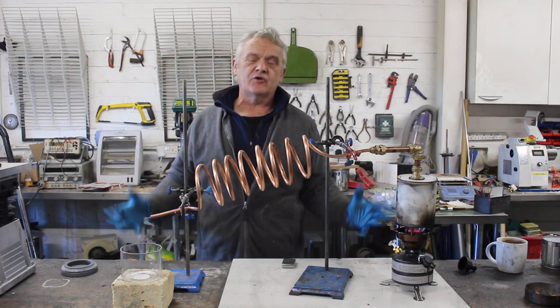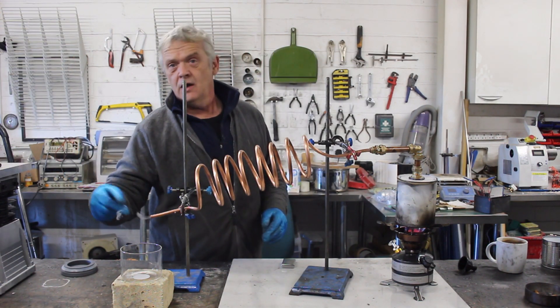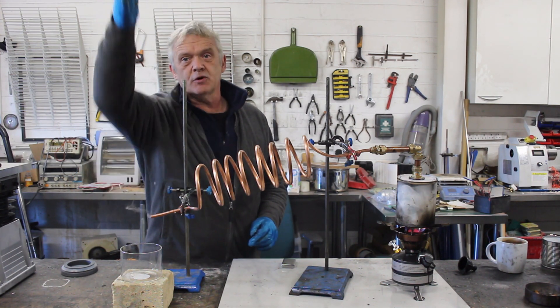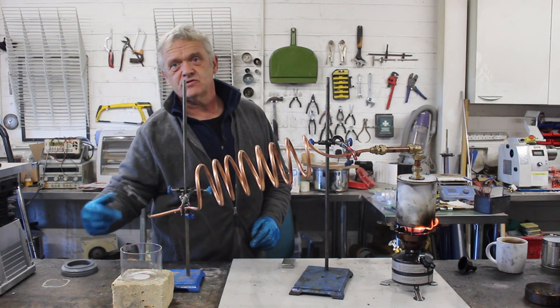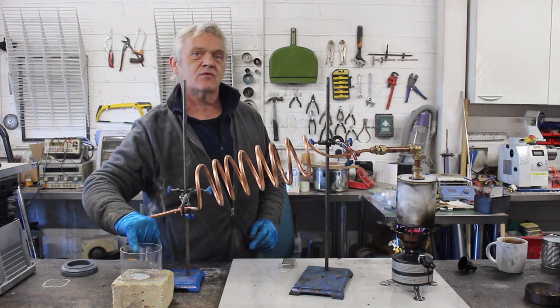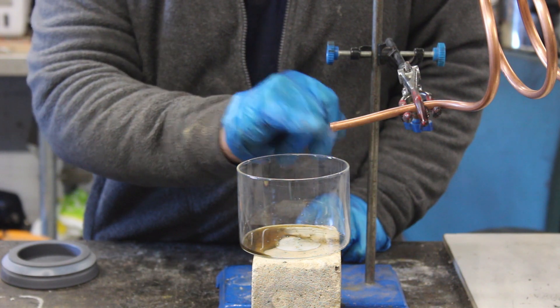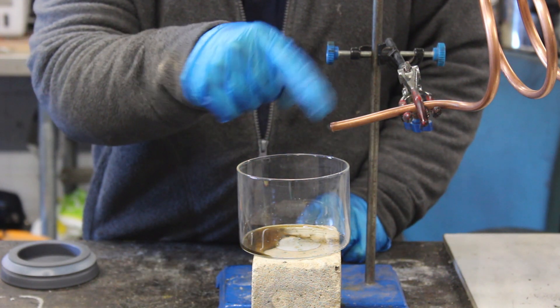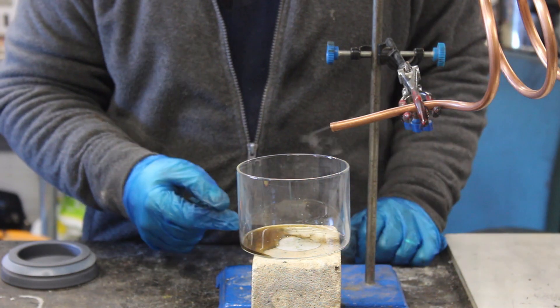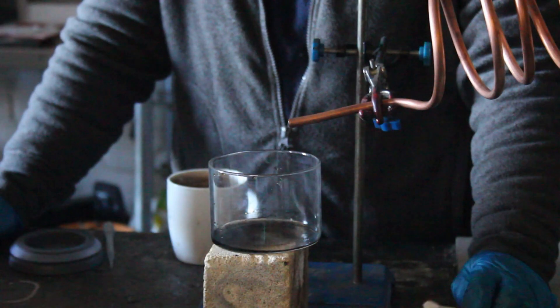Now all we have to do is wait. The gas coming off first is going to be water, and there is going to be some syngas given off as well. We could put a tee piece and put a burner up there and leave it to drip out, but we're not going to bother. We've got good ventilation so I'm going to let the gas escape and collect whatever we get in there. There you go — that is a mixture of water and methanol.